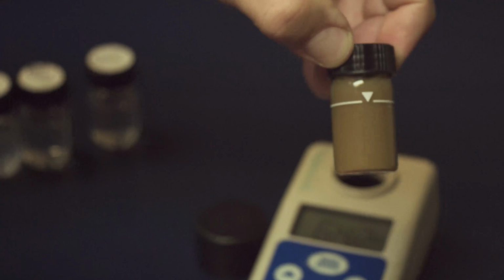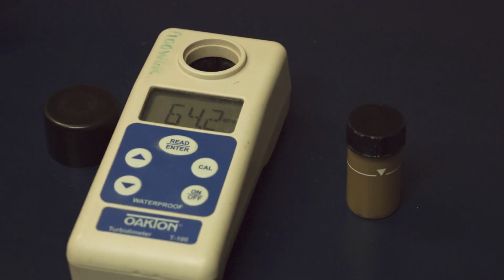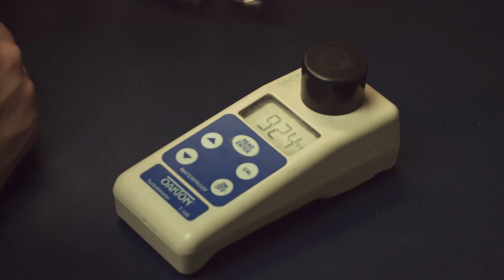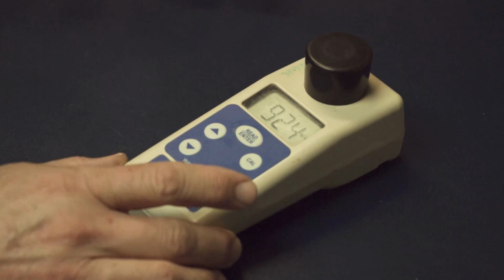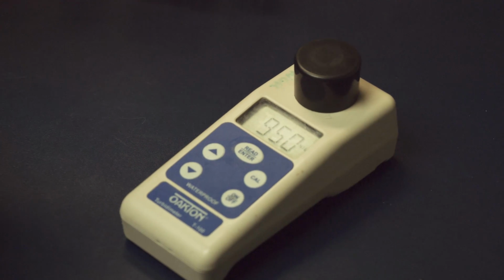In response to this abnormal reading, we decided to let the sample settle for a bit just to see what would happen. After a 15-minute wait, we got the sample to read 924 NTU, a much more believable number based on the appearance of the sample. Another 15 minutes didn't offer much difference.